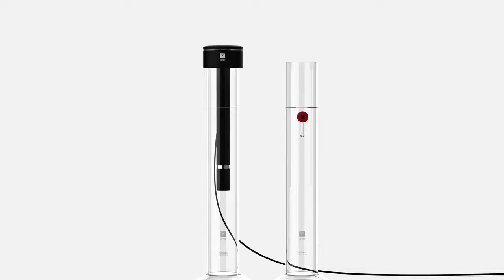Each PARIO device is stored in a cylinder filled with distilled water before and after the measurement. This cylinder is referred to as the standby cylinder. The cylinder with the soil sample in suspension to be tested is called the sedimentation cylinder.